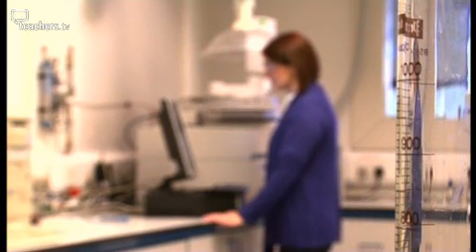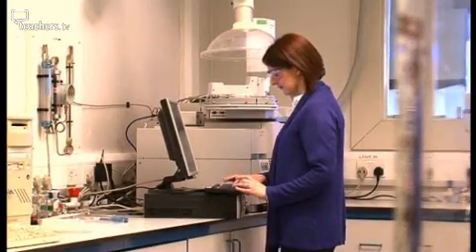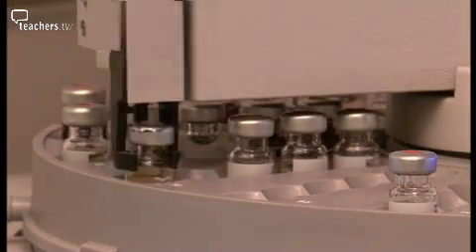This machine finds needles in haystacks. It can locate one molecule among millions and turn an alibi into a lie, or confirm the cover-up of a murder.